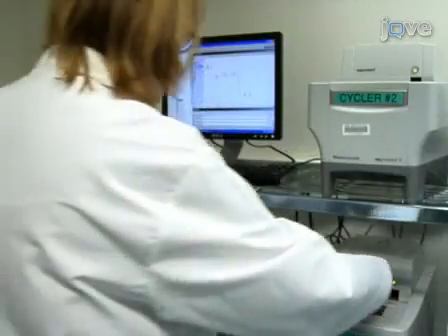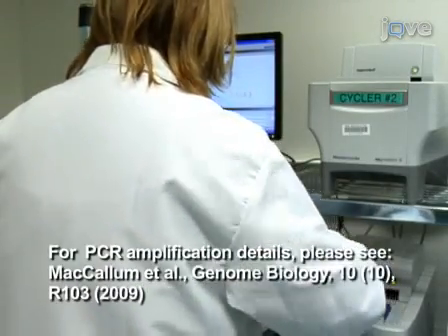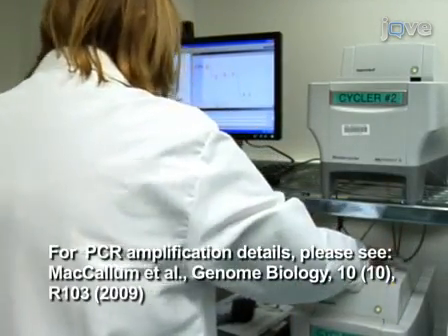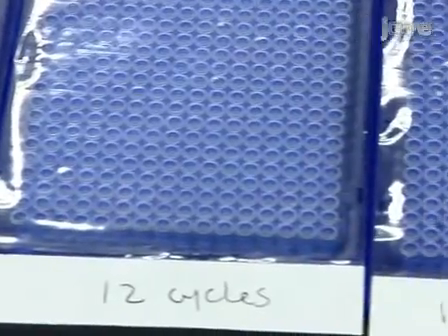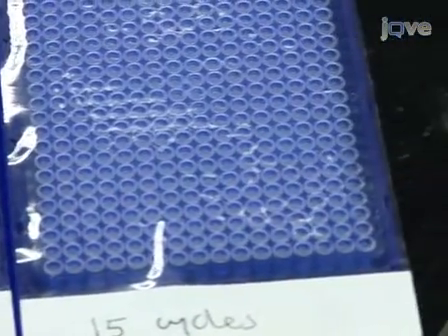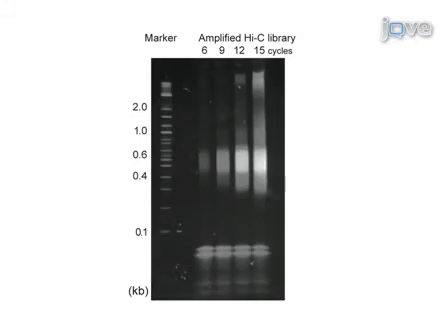To determine the number of cycles necessary to generate enough PCR product for sequencing, set up 4 test PCR reactions with 6, 9, 12, or 15 cycles. Determine the optimal cycle number by running the PCR reactions on a 5% polyacrylamide gel and staining with SYBR Green, ensuring the absence of spurious bands and the presence of a smear between 400 to 600 base pairs, which is the length of the sheared products after ligation to the adapters.